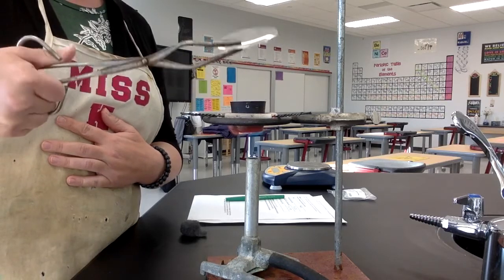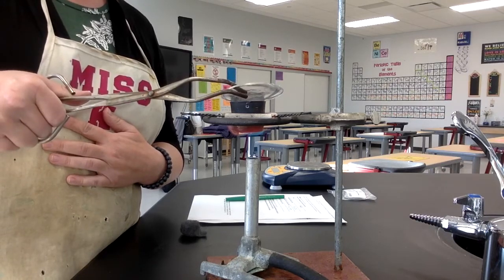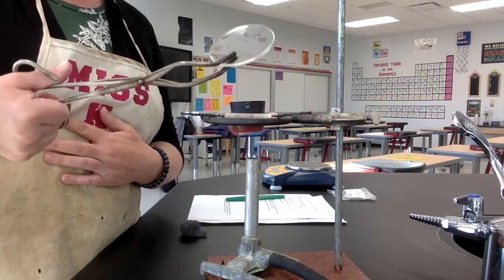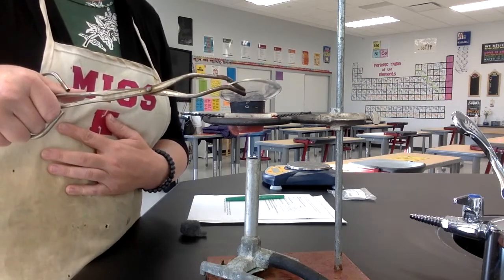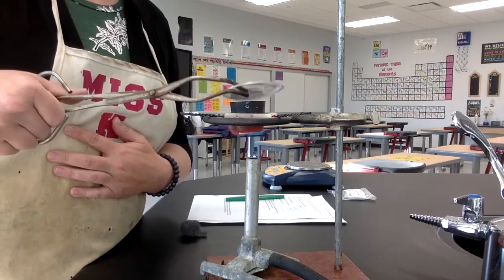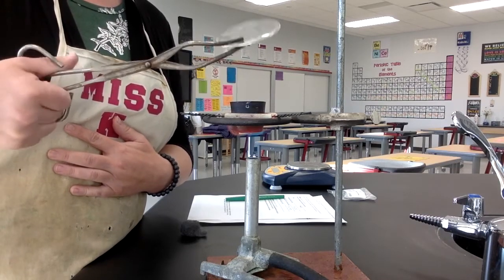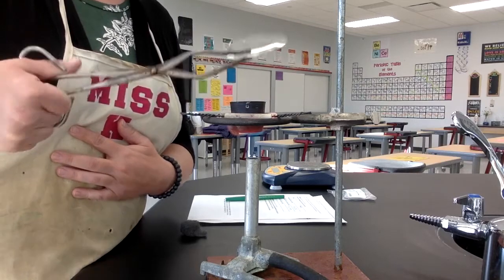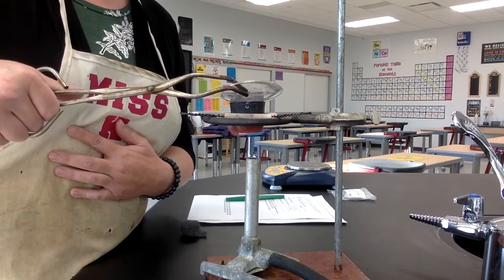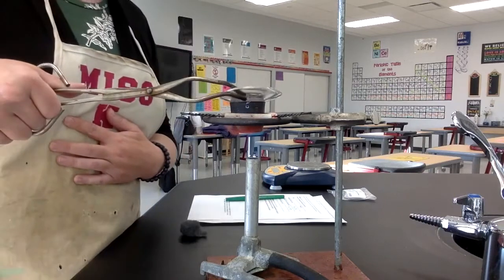Now, when I take this off, are you noticing that there's a little bit of vapors that are escaping? That's some of my product. That's another reason I don't want to keep my cover off for very long, because that can contribute to some error. So I keep doing this on and off thing until I'm pretty sure the reaction is done. I'll know the reaction is done when I take the cover off and there's no more sparking or changing in my reaction. After I finish with this part, I'll hold the computer up again so you can see what it looks like inside there now. All right, so it still seems to be doing some sparking.